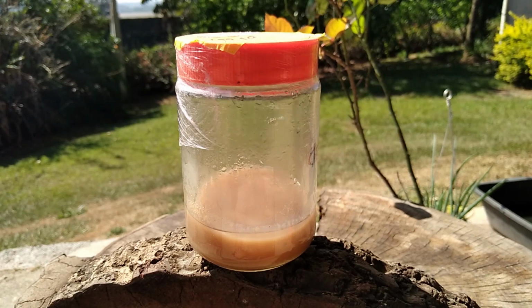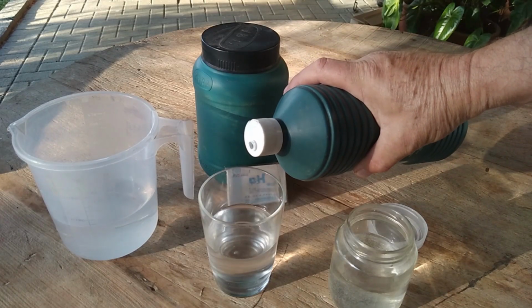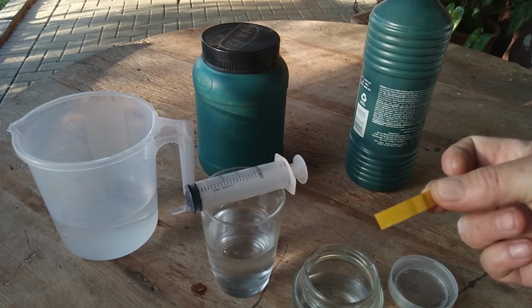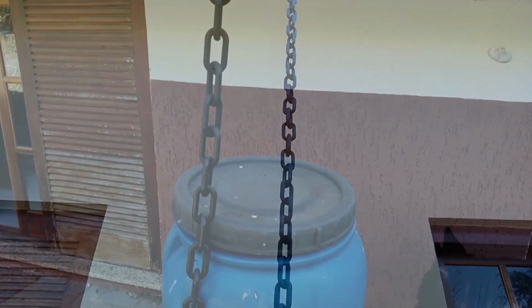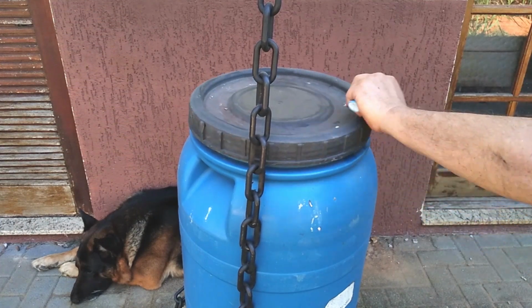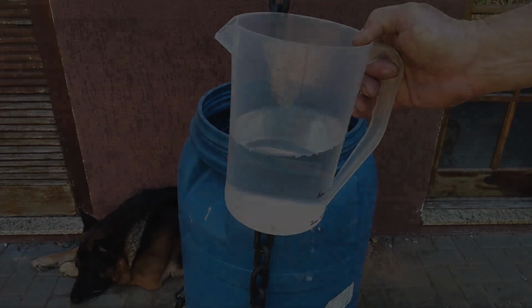The other half of the jars did not have any germination at all, and I think pH is to blame. The water I get from the state company is very hard, which means it has too much mineral dissolved in it. We can try to adjust the pH, but in short time the minerals bring the reading up high again, and that's bad for germination. Taking from these first bad results, I began collecting and using rainwater, and my rate of success improved manifold. You can also use distilled water, but we try to keep all costs at a minimum around here. Boiled rainwater works really well.